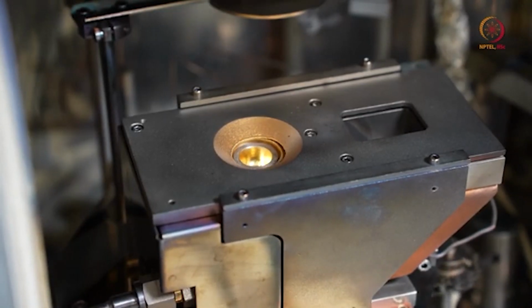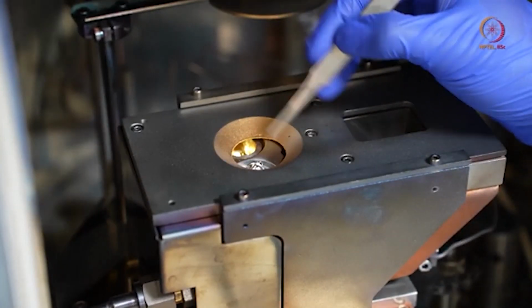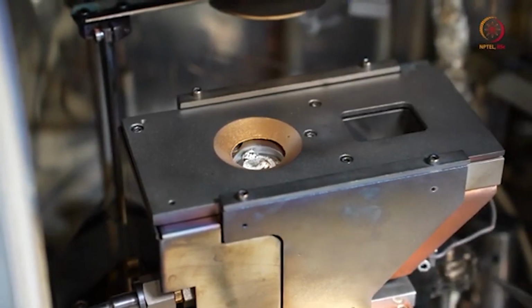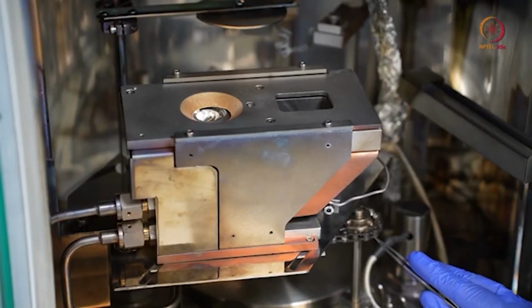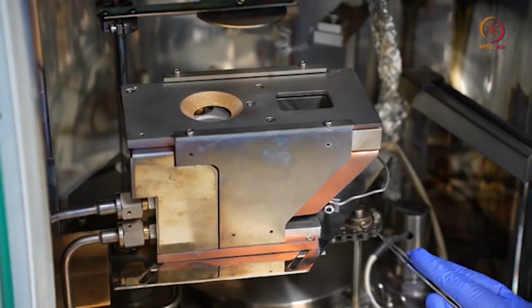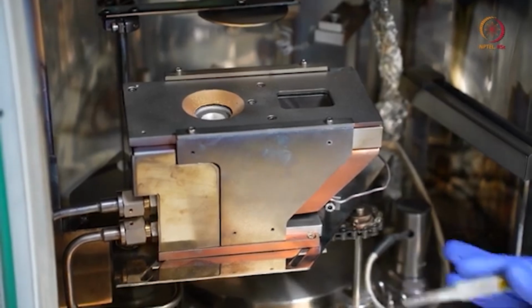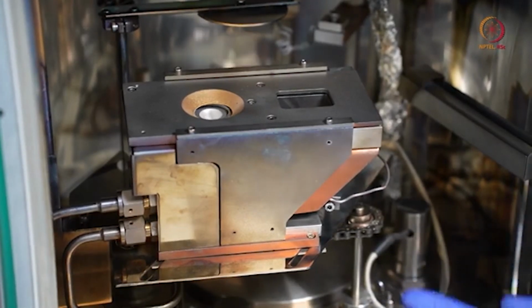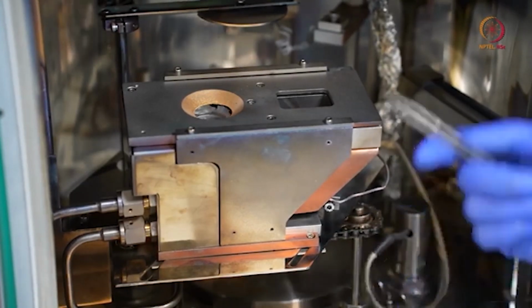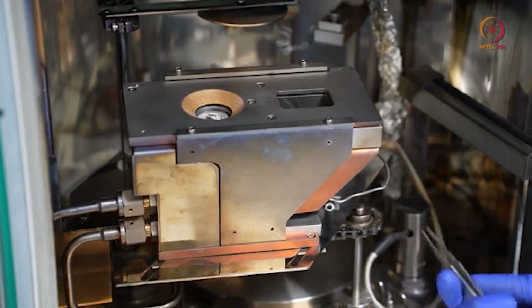Okay, so this is how the turret controller is used. And here if you just see, it's rotating. You can check it from here. If some problem happens here, then definitely the rotation will stop. As I was telling, in our case it is crucible 3 for our tool. We kept titanium in crucible 3. So let it reach crucible 3, then this will be stopped by itself basically.